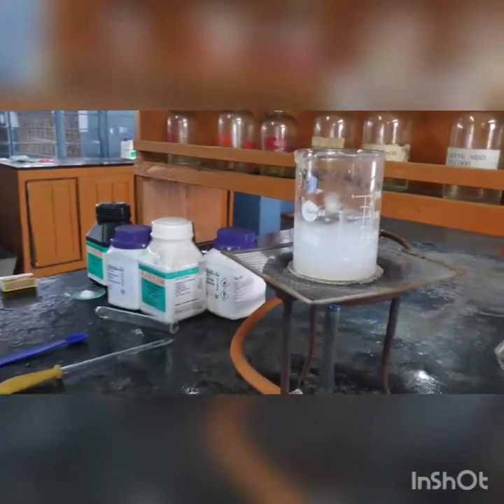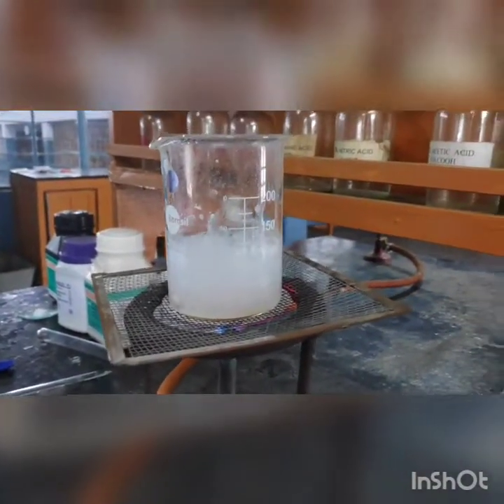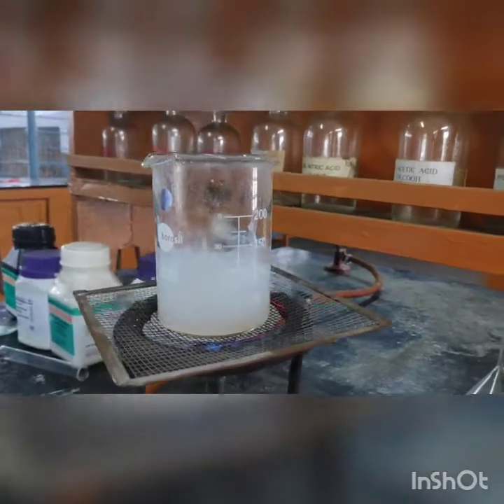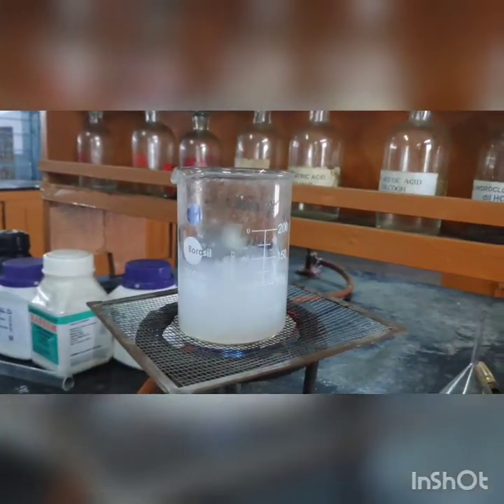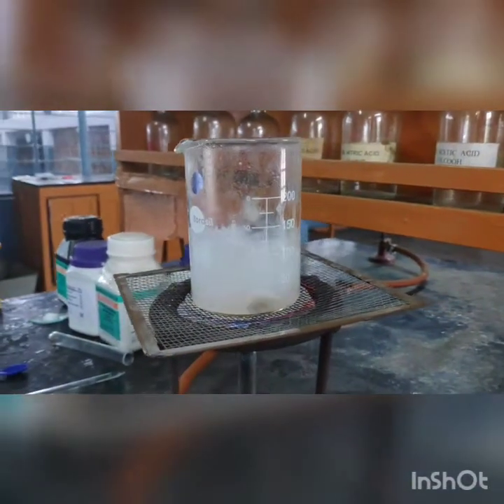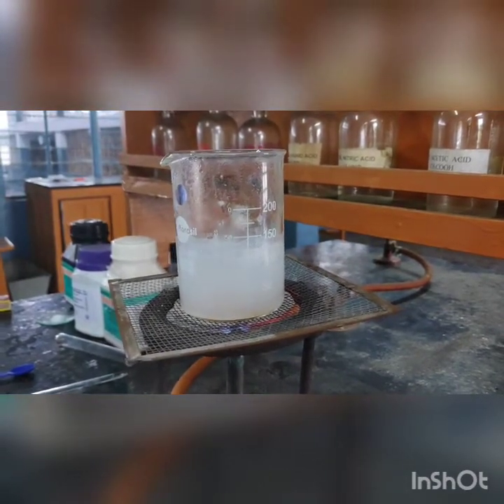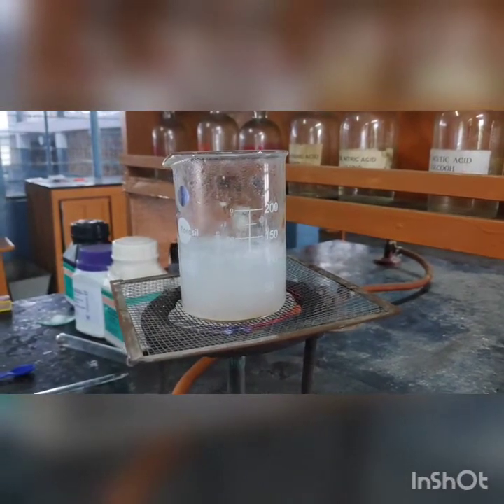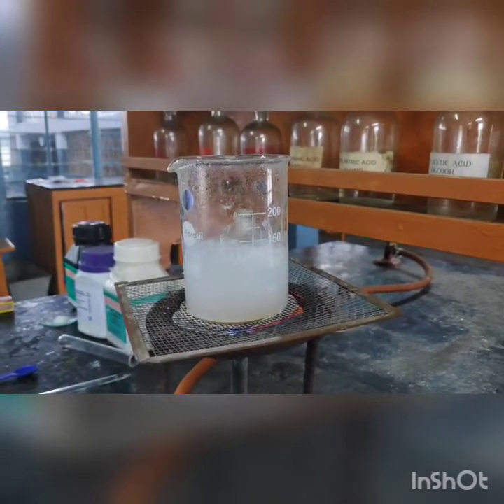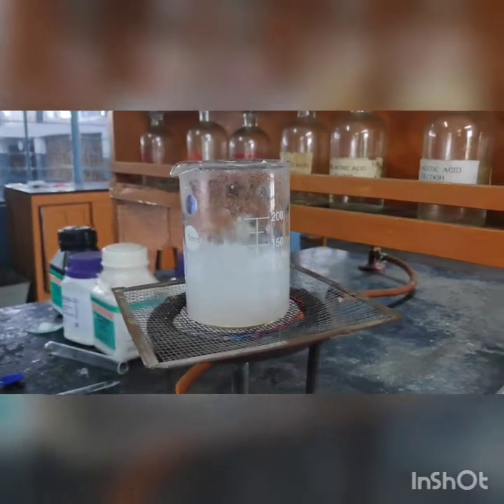You can see the solution is turning turbid, which means the carbonate salt of the cation — which is insoluble — is seen as the white turbidity, and the anion is going to combine with sodium to form soluble sodium sulfate.